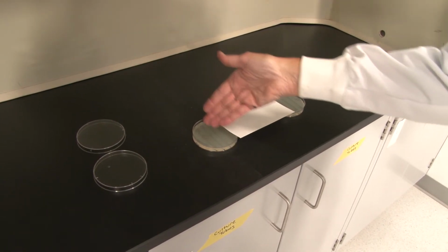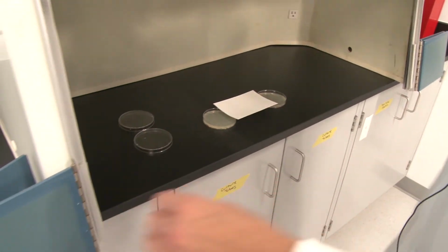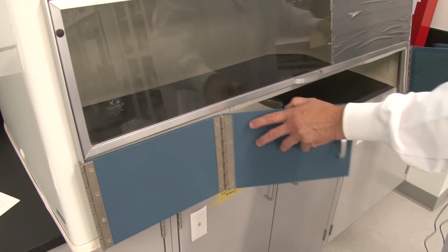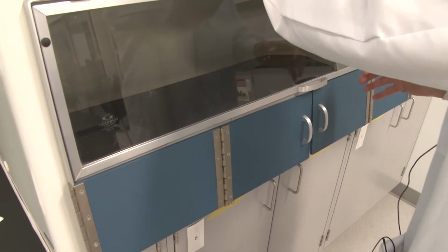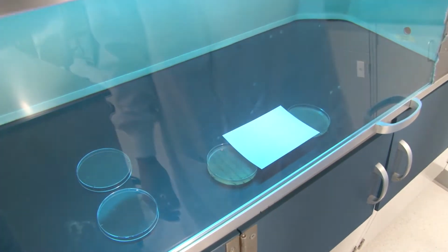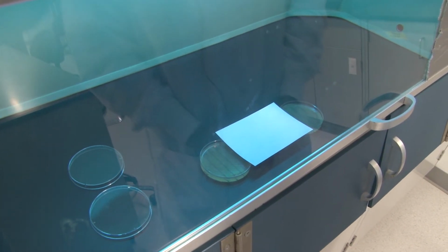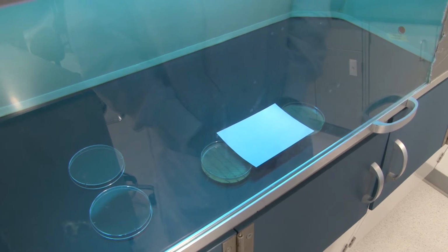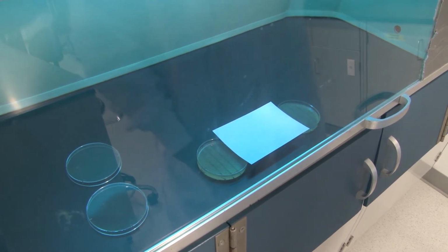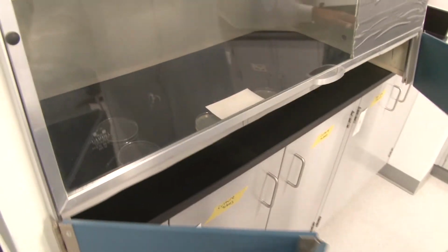10, 20, 30, and 60-second exposures. The zeros remain covered entirely. So we're going to shut this back up. I'm going to reset my stopwatch. I'm going to turn this on when it turns purple. Start it up. There we go. And 5 seconds, 6, 7, 8, 9, 10. There we go. We are done.